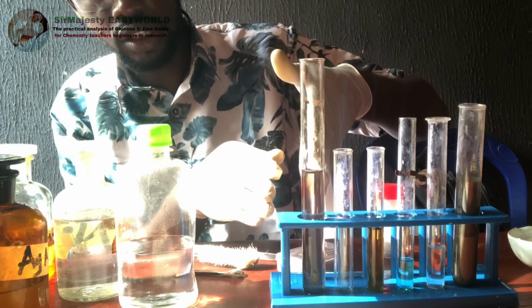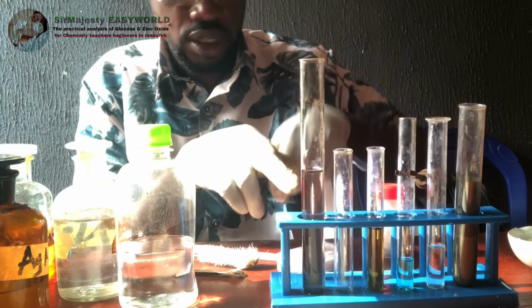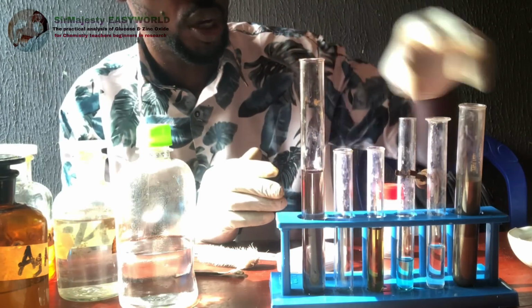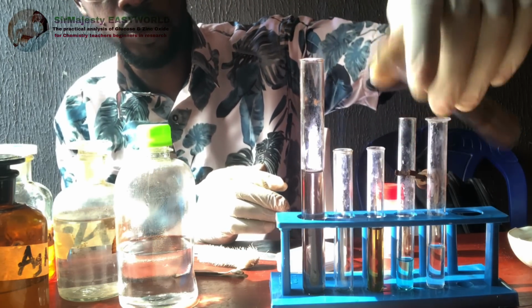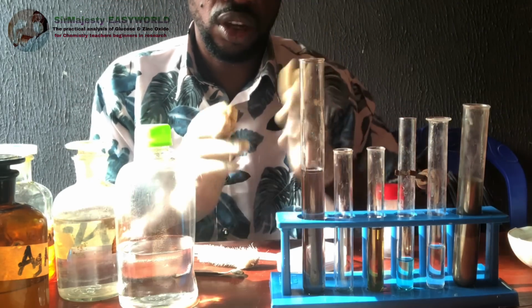How do you distinguish zinc oxide? If you watch this thing on standing, I think you see it's turning gradually. It's forming that brownish silver deposit on the walls of the test tube, which when left for a while, you see it's becoming more like this. So there is a deposit of silver as I'm explaining this already. But I want you to know the difference between zinc oxide and zinc carbonate.